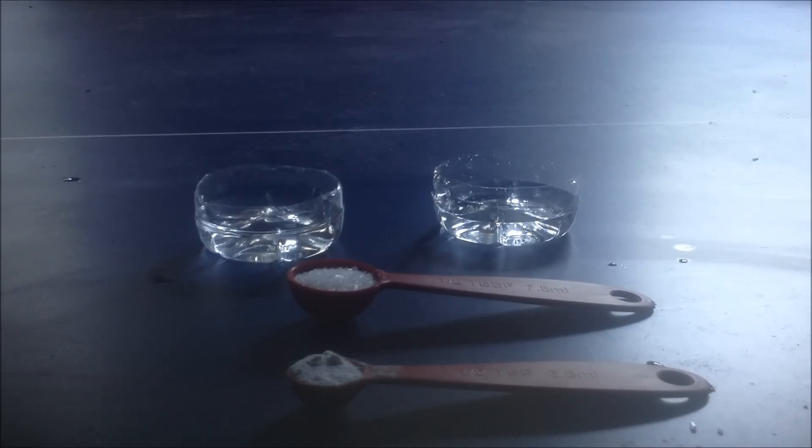Now this is a precipitation reaction, and it's a good reaction for introducing people to precipitation, which is a reaction where one of the products formed is not soluble in the solvent, and so it goes out of the solution.